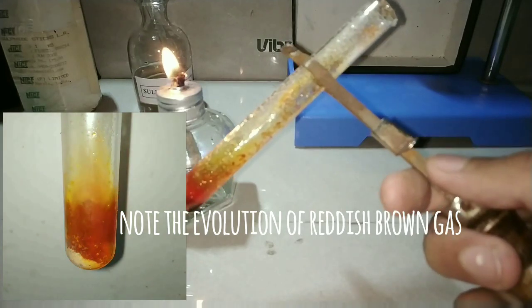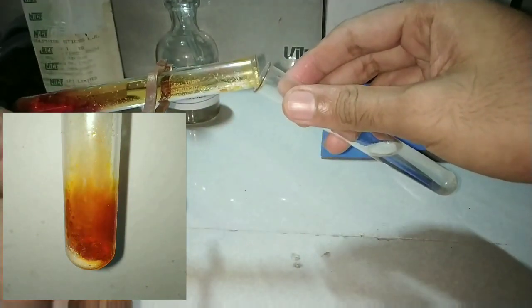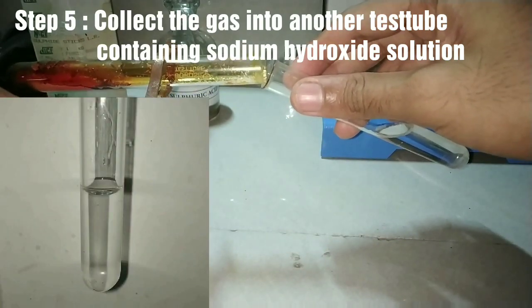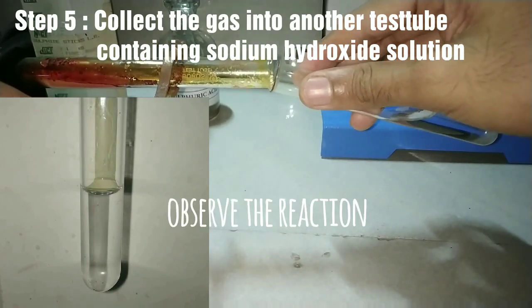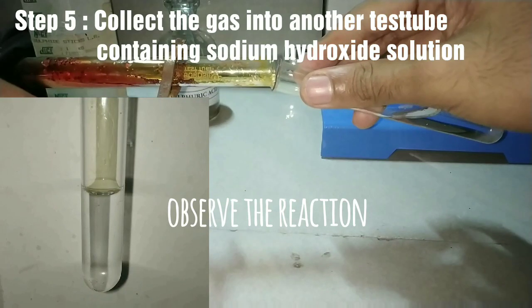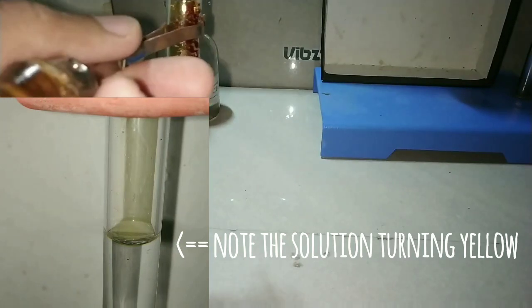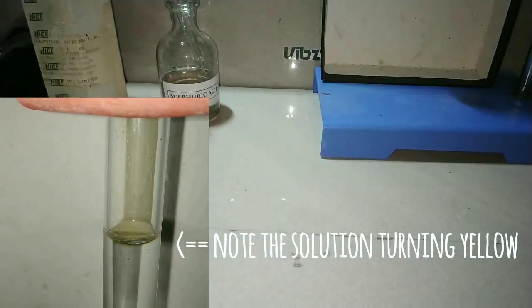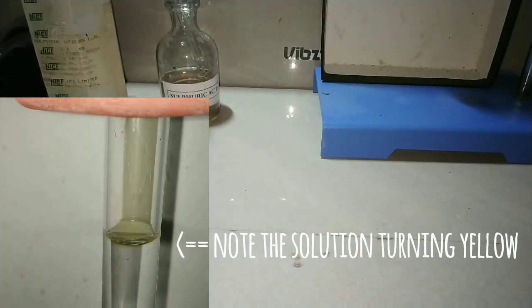Now we heat the contents of the test tube. While heating, we note the evolution of a reddish-brown gas. Step five is to collect the gas in another test tube containing sodium hydroxide solution. You can observe the gas touching the surface of the sodium hydroxide solution, dissolving in it, and the solution is turning yellow.